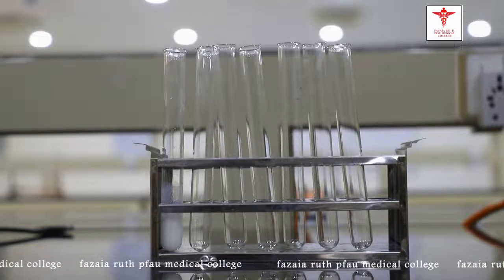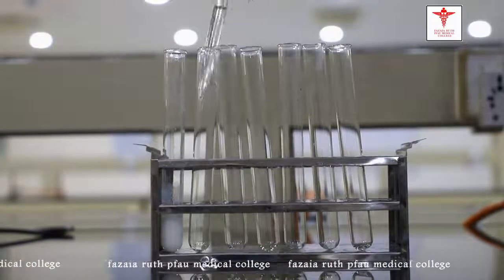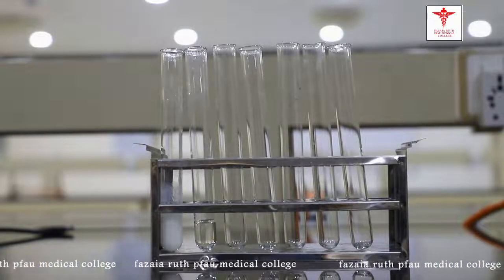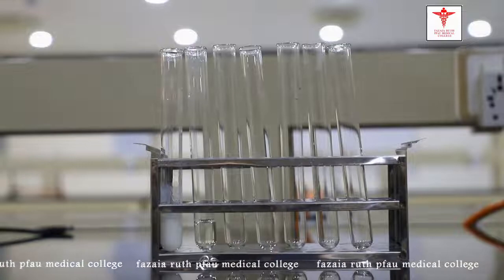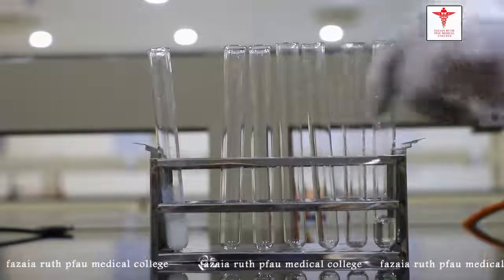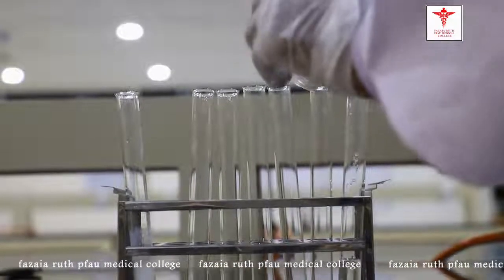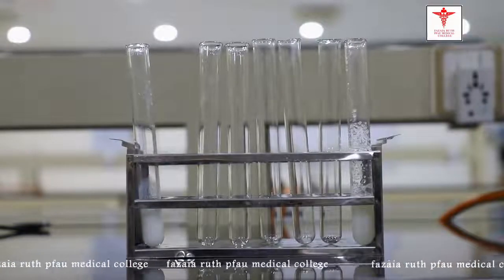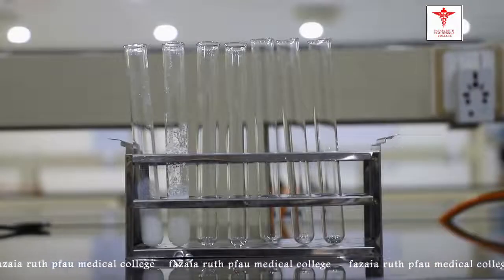Next we have the sulfosalicylic acid test. We add 3 ml of original solution to a new test tube, then add 1 gram of sulfosalicylic acid. We can see it is also giving us a white precipitate, showing the presence of protein sulfosalicylate.